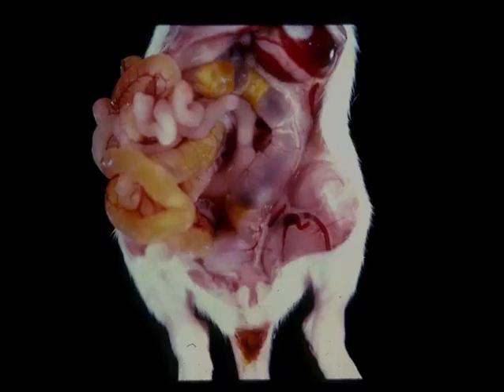Certain strains, including BALB/c, are relatively susceptible. This is a white mouse, perhaps it's a BALB/c. And then certain other strains are considered relatively resistant, including B6 mice. Characteristically, the disease is seen in mouse pups less than 14 days old. They have abdominal bloating, this pasting of the feces, and they are runted. They continue to nurse, and then older mice within the colony will show absolutely no clinical signs.